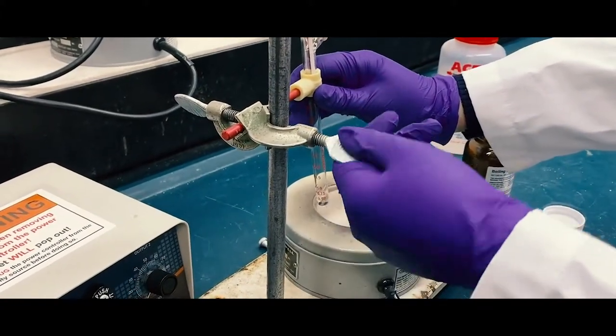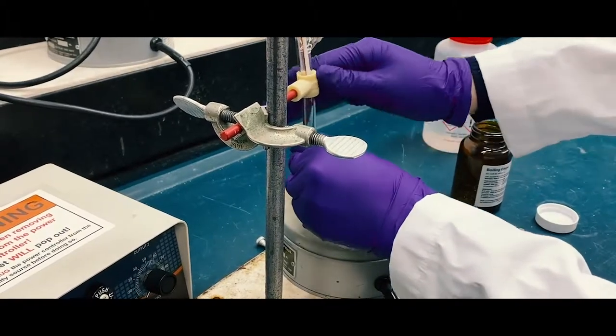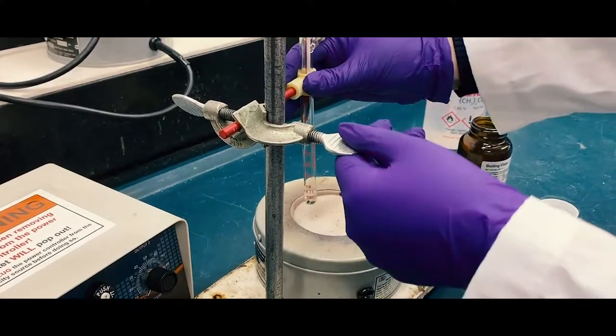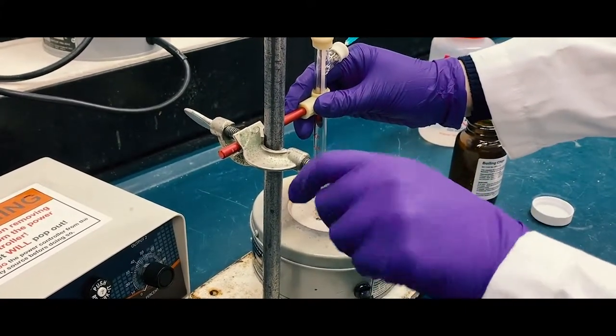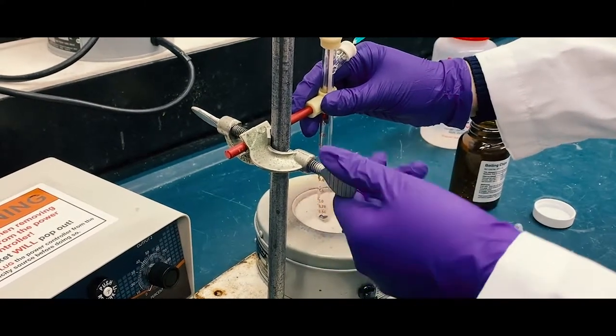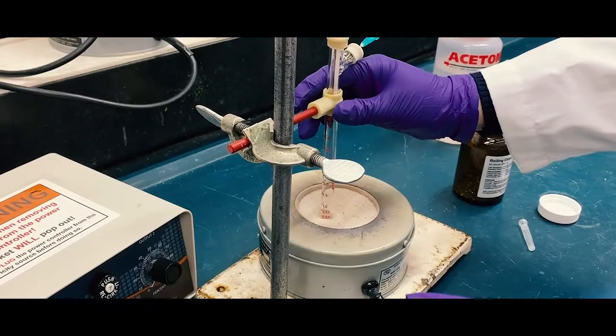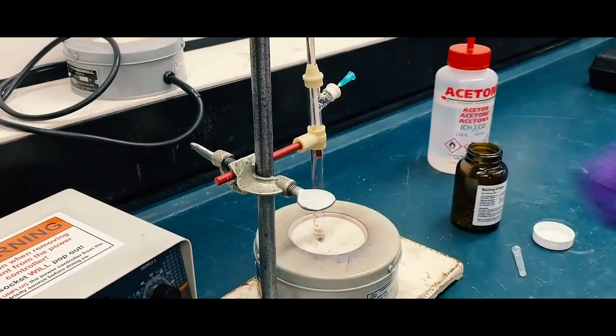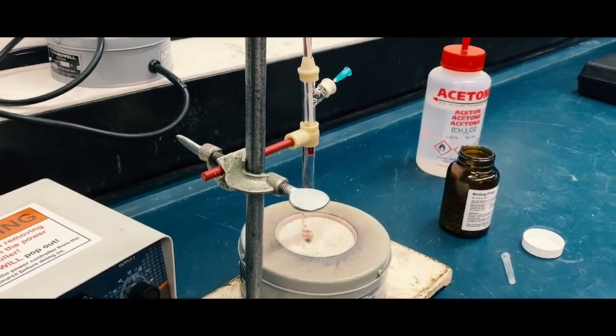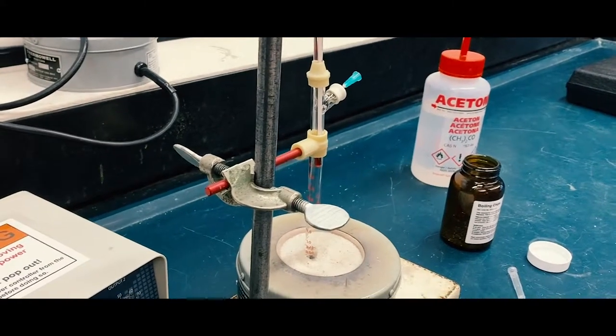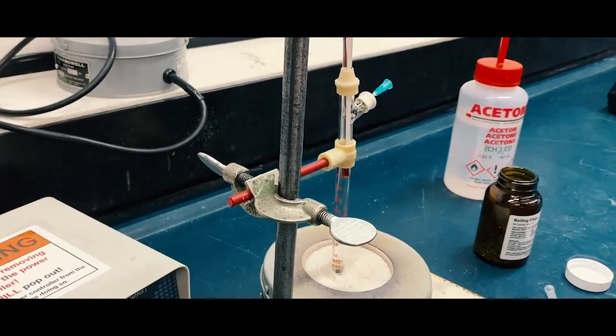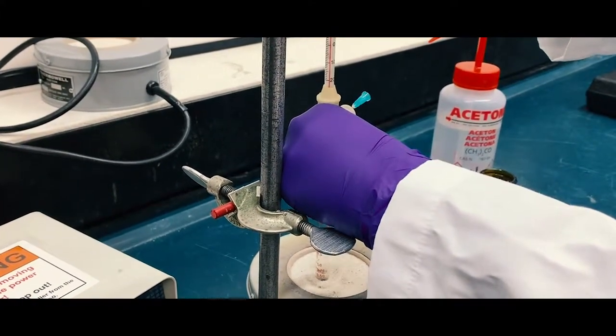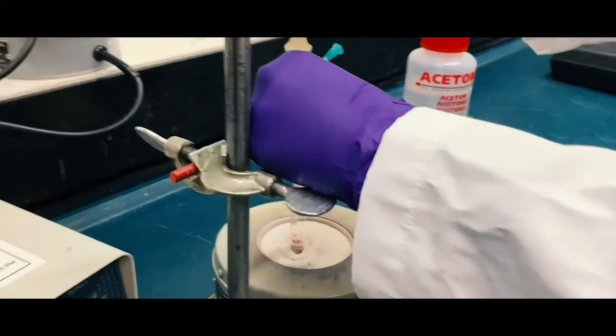Push the test tube into the hot sand and then turn. Then push down the thermometer until it is close to the surface of the liquid but not touching the liquid.